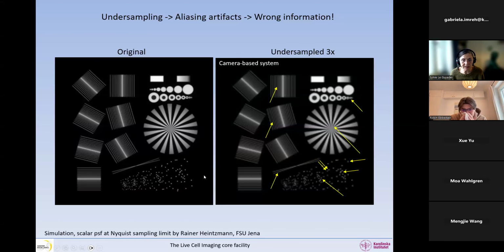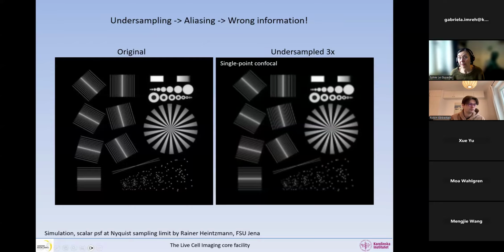And we can look at these 2 dots here. They have the same size and the same intensity, but one of them looks much dimmer than the other in this undersampled image. Okay? So now if we're looking at what happens in a single point confocal instead, it's the same thing basically. You can see pretty much the same type of artifacts in this undersampled image in a single point confocal.